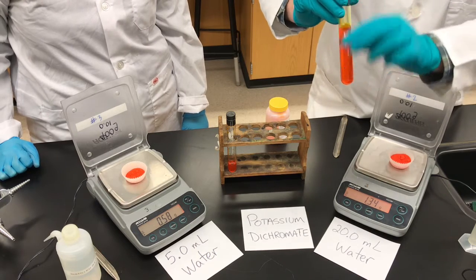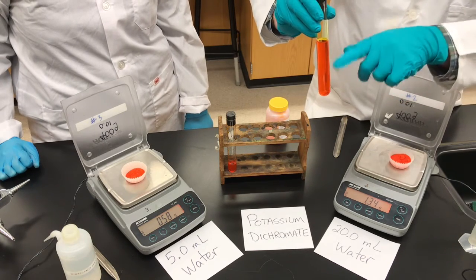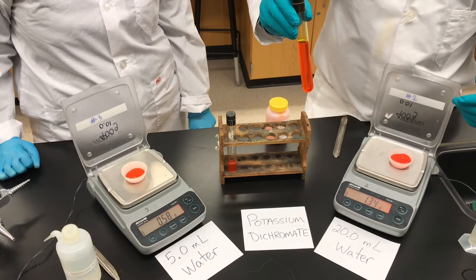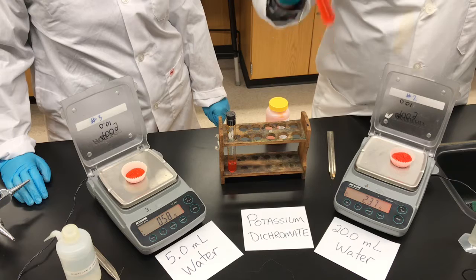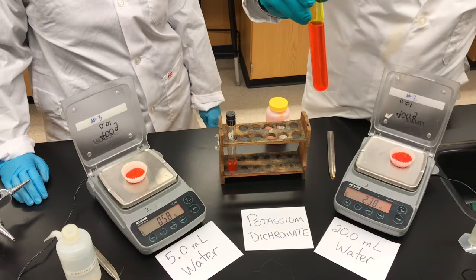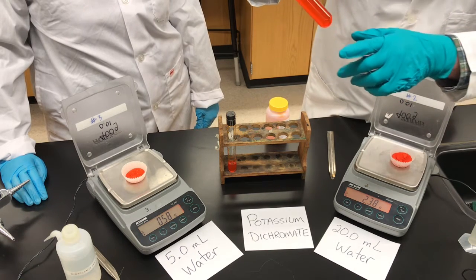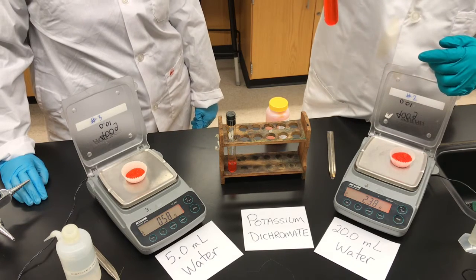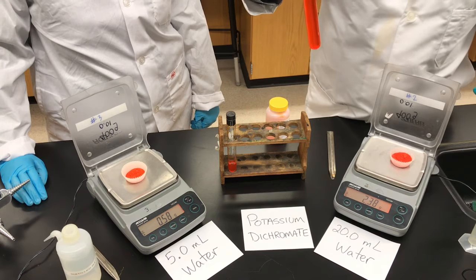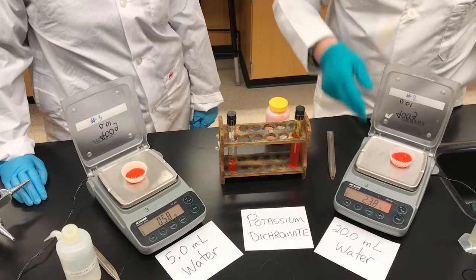I'm going to keep adding more salt until I also have a saturated solution. It's taken me a few more minutes than Mrs. Watts — she had a smaller volume so she finished faster. I've now got a saturated solution of potassium dichromate. I can see it's mostly dissolved, but at the bottom, despite shaking for the last 2 or 3 minutes, there's still a little bit of undissolved salt. I'm confident it's saturated because there's undissolved salt after several minutes of shaking — it's reached its maximum concentration. My mass reads 2.38 grams.